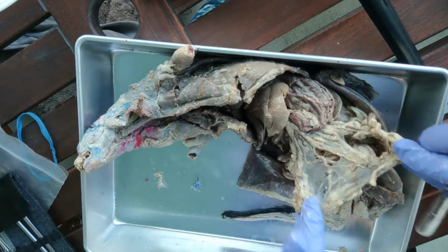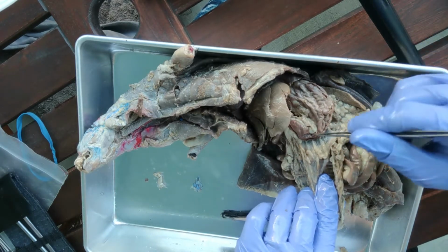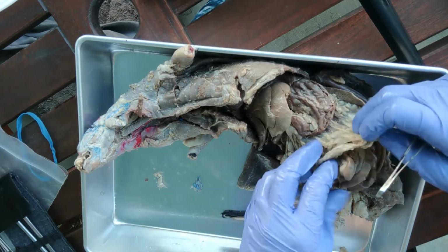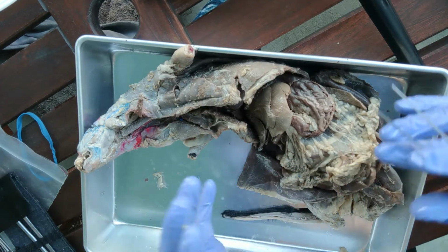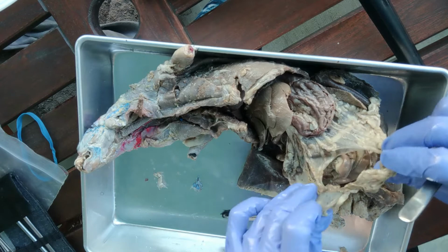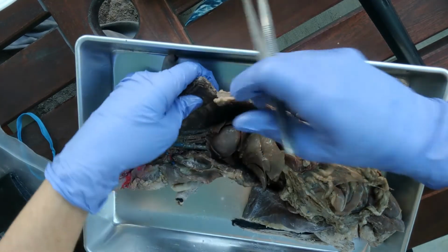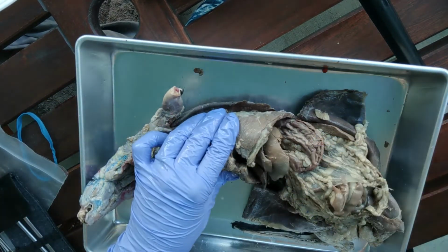Oh, by the way, see this right here coming off this is called the greater curvature of the stomach, coming off of that side here. This is called the greater omentum, and so if you have a beer belly, the part that has the stored fat in it is the greater omentum, and it covers over the intestines. And if you'll notice in this region here, we have the rib cage, and that's a lot of good protection for those organs in there.